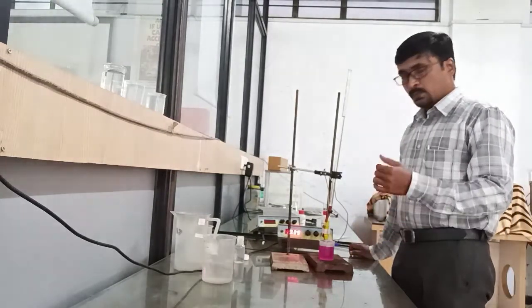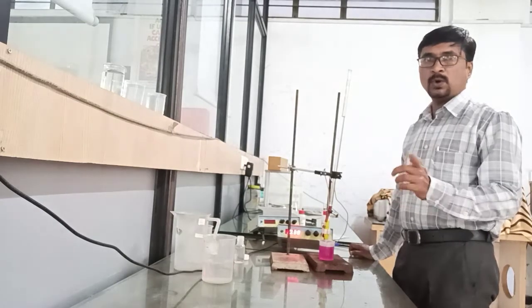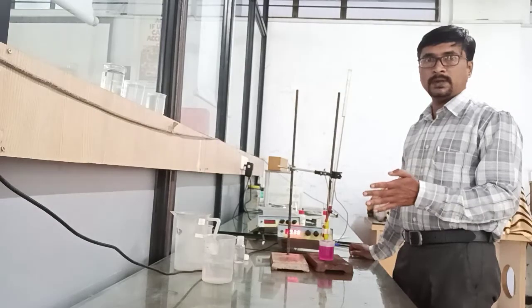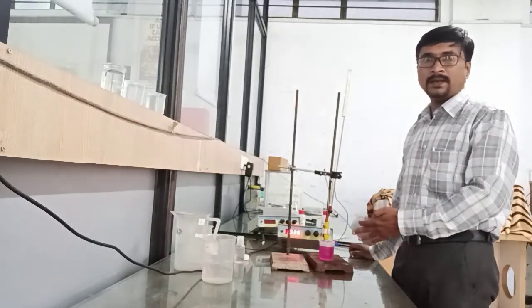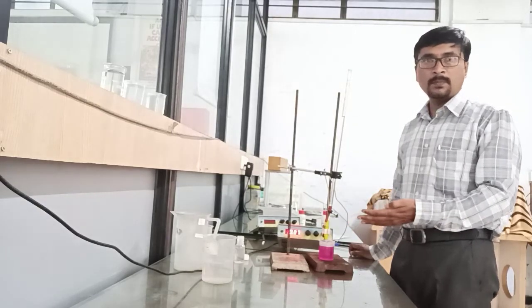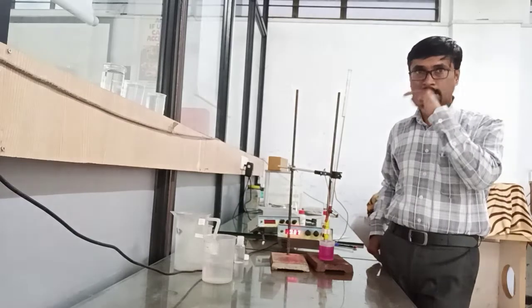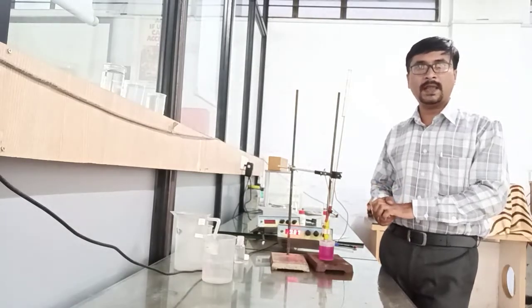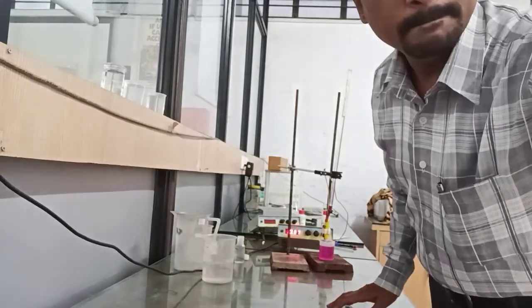We can use this value as the end point. By using the formula N1V1 equals N2V2, we can calculate the normality of the prepared nitric acid solution. And from the normality of nitric acid, by multiplying it with the equivalent weight, we can calculate the strength of this commercial grade nitric acid. Thank you.